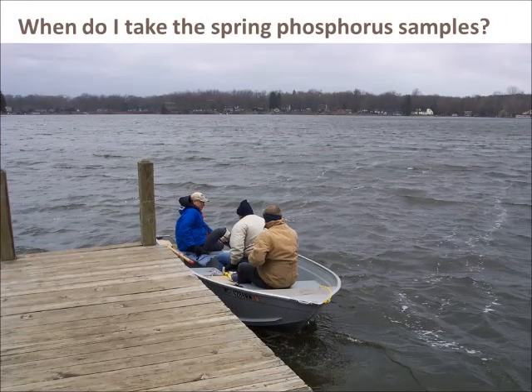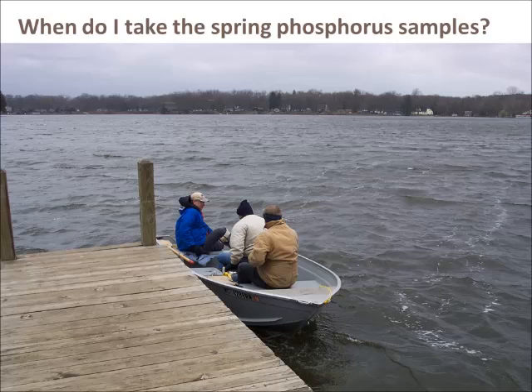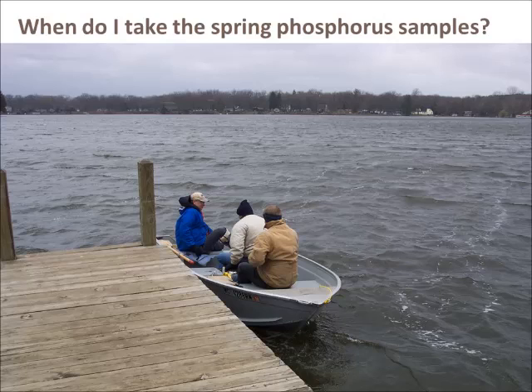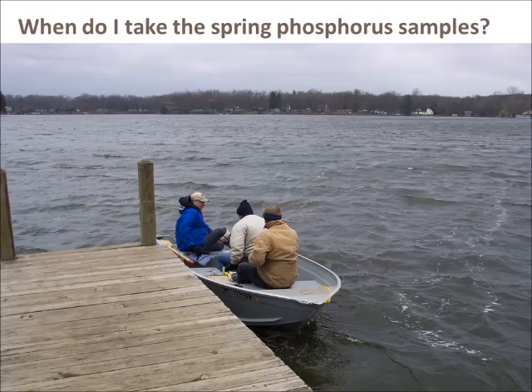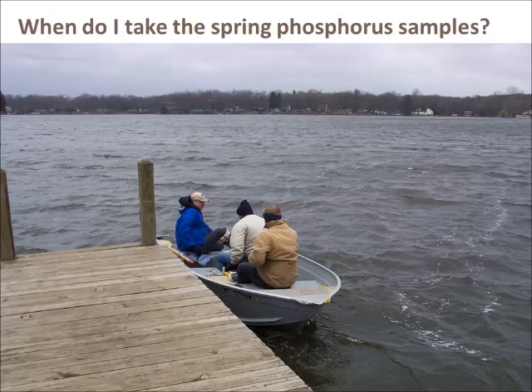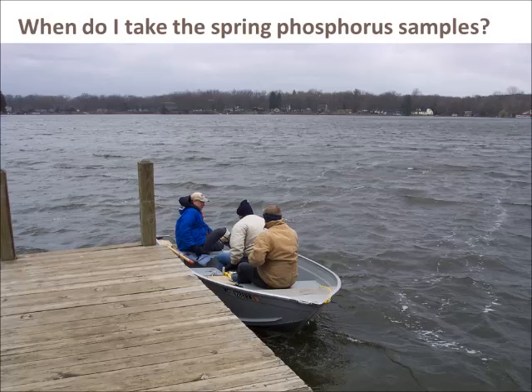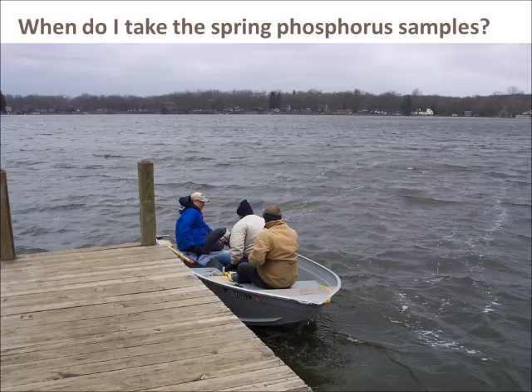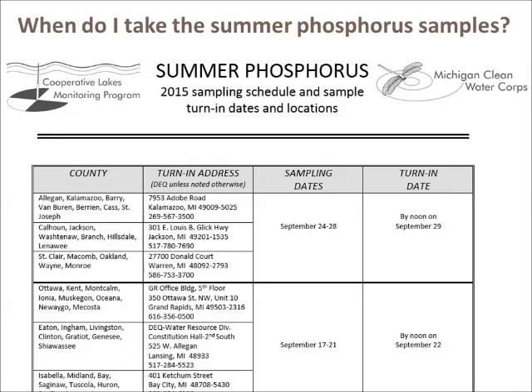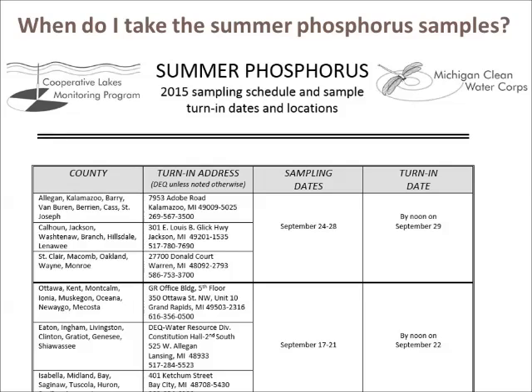There is no set date for spring phosphorus sampling. The goal is to sample the lake within two weeks after ice has entirely disappeared from the lake surface. Since every lake will have a slightly different date of ice out, it is up to the volunteer to determine this date. Please note that this is a change from past years, when CLMP staff attempted to predict the ice-out date for the lakes. Lake residents are best suited for determining ice out for their lake, and this change will result in samples that more accurately reflect spring turnover conditions. The summer phosphorus sample needs to be taken in August or September, with a date range depending on the county in which your lake is located. These dates are listed on the summer phosphorus schedule.